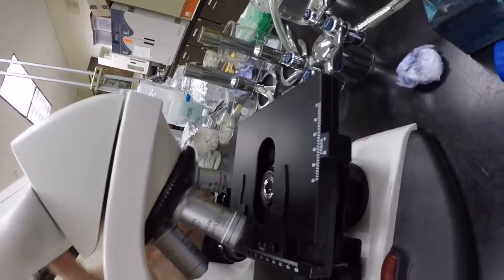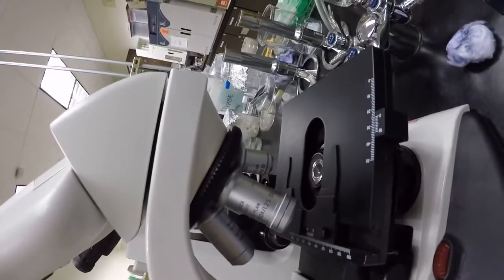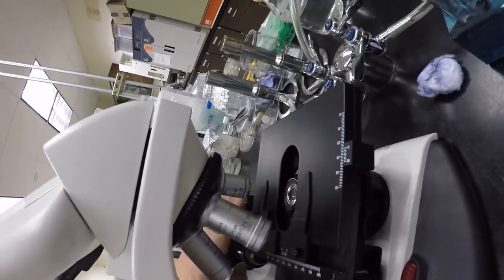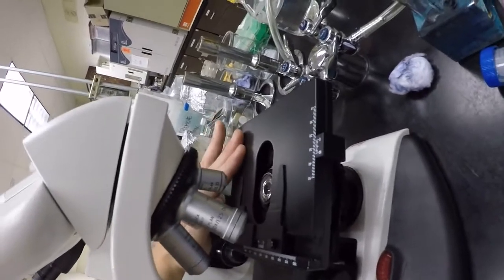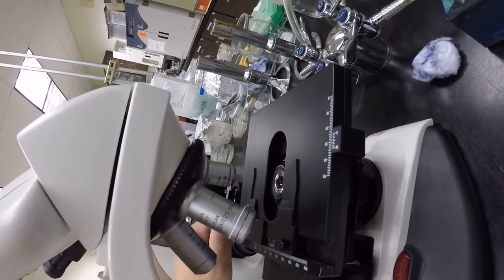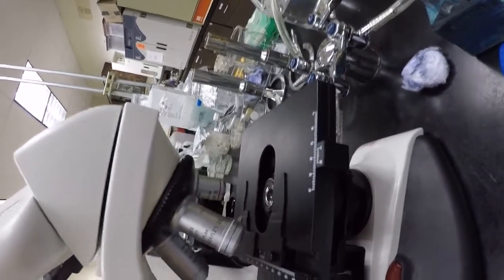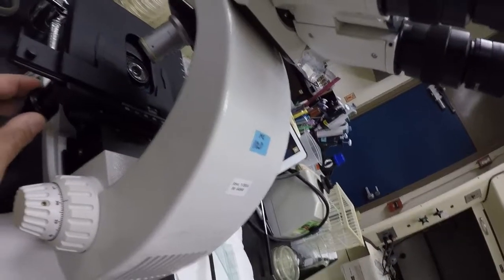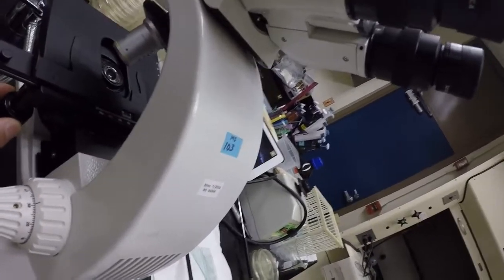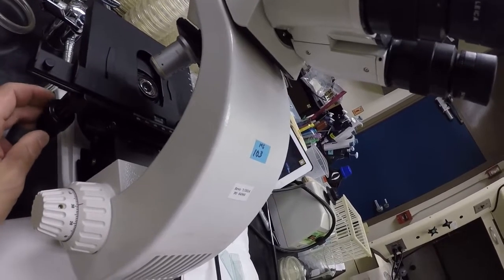Now, our red and our yellow, our 4 and 10 times lenses, are safe lenses. They are the shortest lenses, and they will never ever touch this thing, which is what we call our stage. The stage is where the slide sits, and this thing down here is called the stage clip. This holds our slide in place, allowing us to move our slide around, right? And in order to move our slide, there are these controls here with 2 knobs. One knob moves the slide stage clips forward and back. The other moves it side to side.